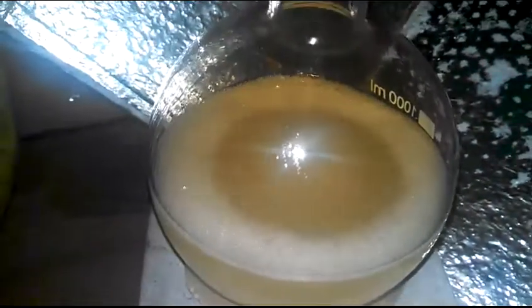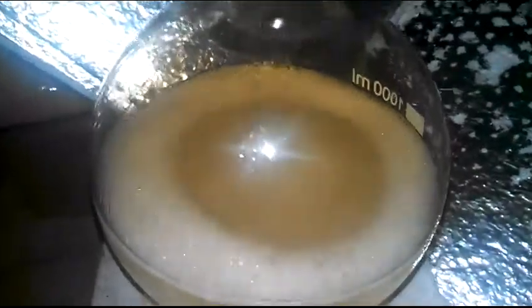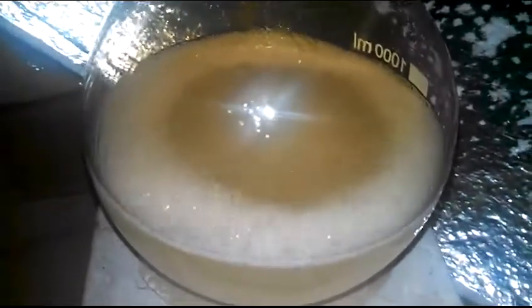I'll throw the column on and distill it again so I can get that 68% azeotrope. I'm not trying to use up the concentrated nitric acid. It's just a waste. Besides, it winds up passivating the base metals that I'm trying to dissolve in the first place, so it's pointless to use the concentrated nitric.